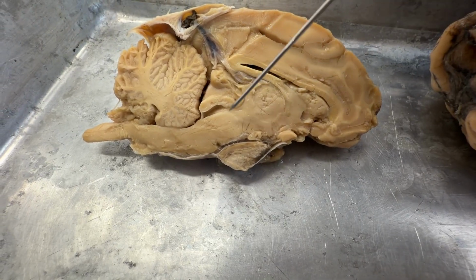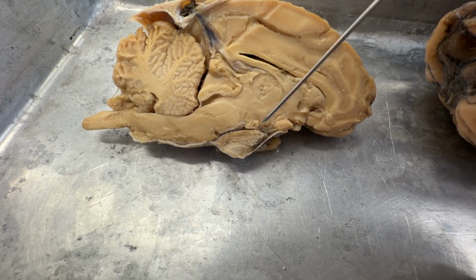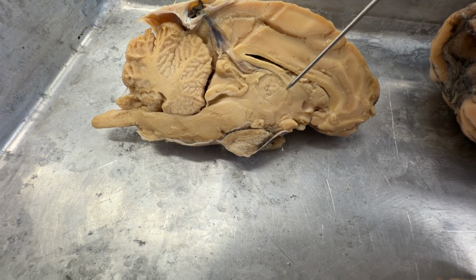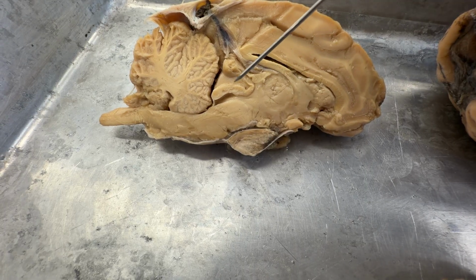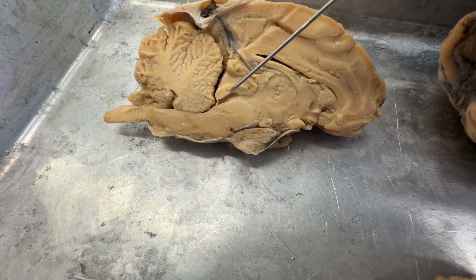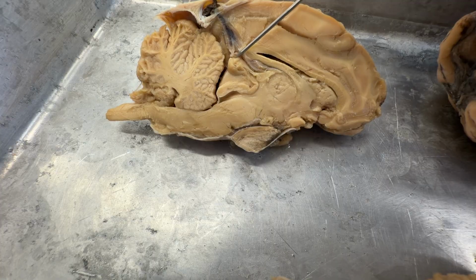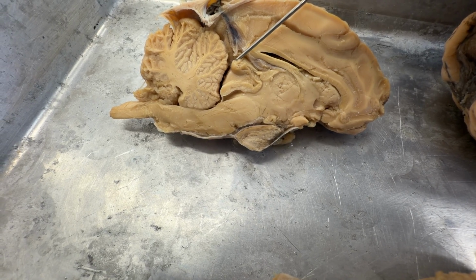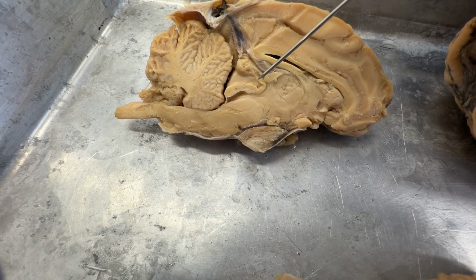Right here we have the diencephalon, and down below, there's no real clear good line down here, but down below is the hypothalamus. We'll make it clear if it's in the hypothalamus. The thalamus is the middle part, and this central circle here is called the massa intermedia of it. And then the epithalamus is above it. You can also see our tectum here, which is the colliculi. The main part of the epithalamus here is this gland, the pineal gland, and there's also some connections here between the two halves.